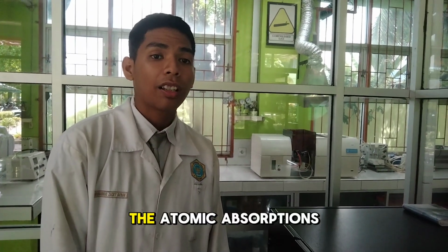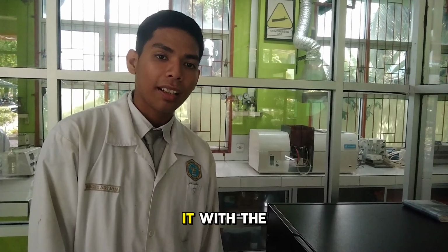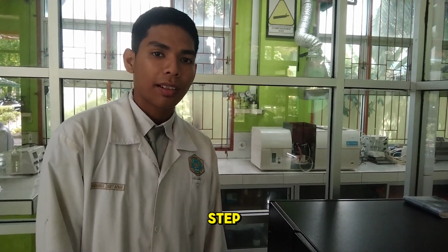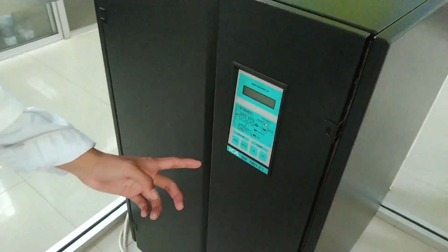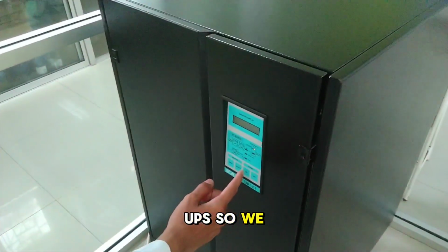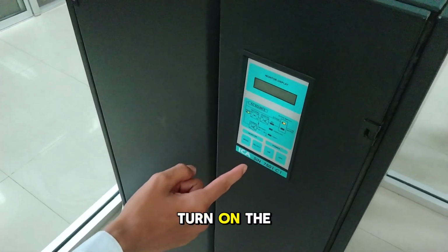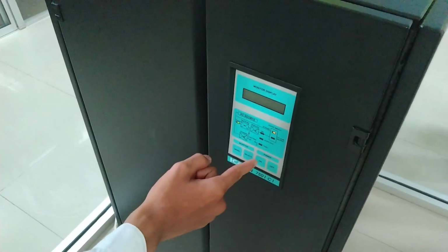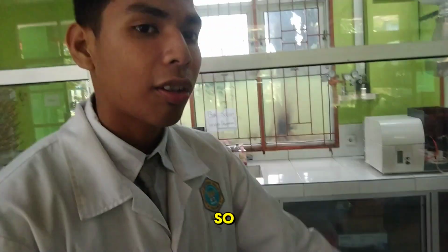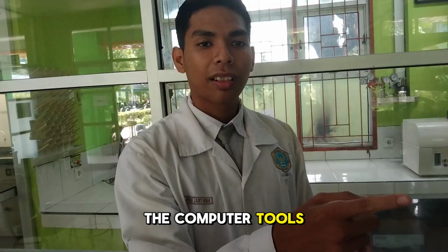The atomic absorption spectrophotometry tool will not turn on by itself, so we need to turn it on step by step. The first step is to turn on the UPS by pressing this on button, and the UPS will turn on. The next step is to turn on the computer, the tool, and the gas.